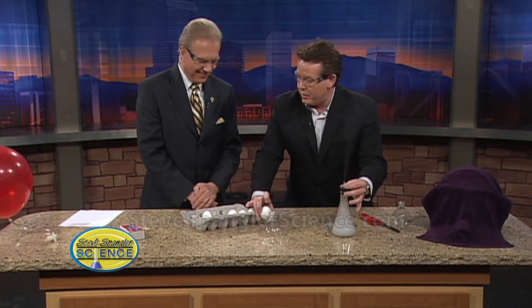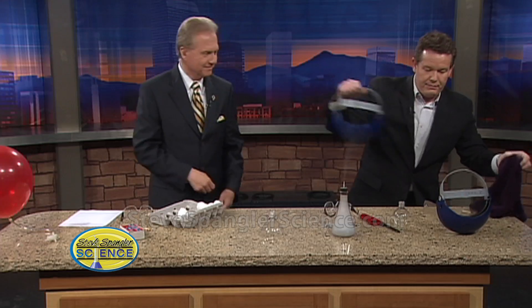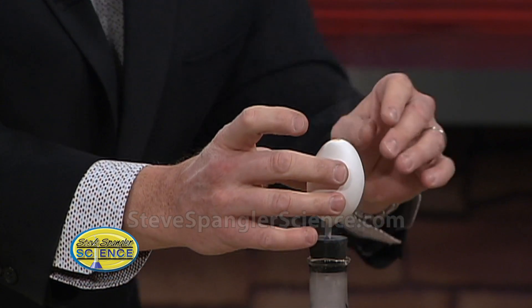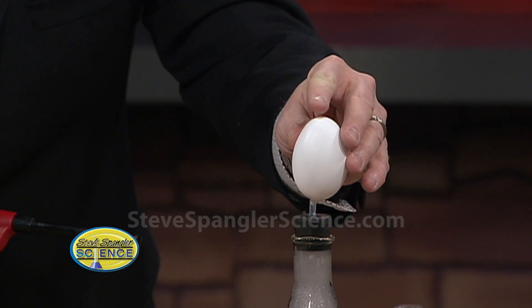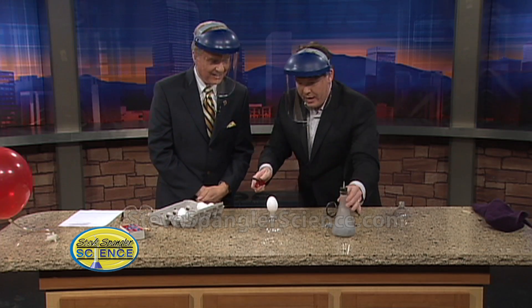So now here's what we do. Let's move this out of the way. Here, I got an idea — why don't we take your glasses off for a second and substitute them for the safety shield. So get the safety shield on. Now I'm going to put the egg over the top like this. You see how we're generating the hydrogen gas? So now I'm going to put my finger over the top here so we have gas. My heart's left unprotected, I'd like to point out. And so now we put this here. Got it? Okay.